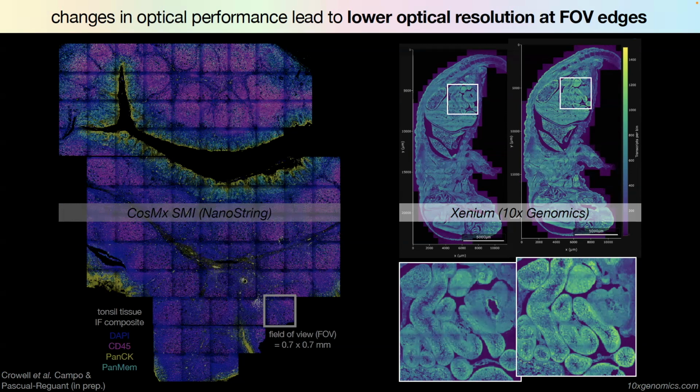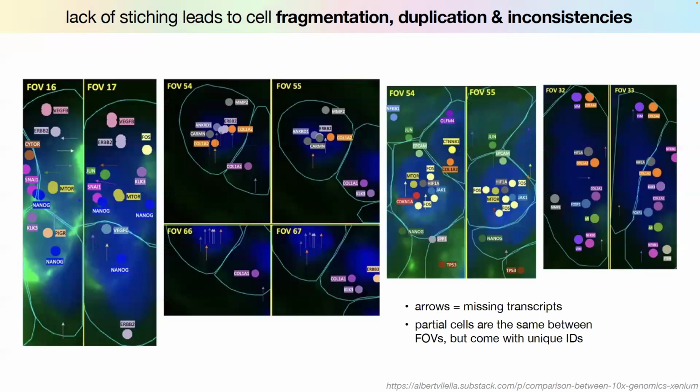And what you saw earlier is that I'm removing some of the cells that are just right on the border. And that's because, this is the blog post that I was writing about. They show two adjacent fields of view. That's the same cell. You see it has the same transcript, but then the green one is missing over here, and that one is only observed in this cell. And then they say the issue is we have fragmentation, we have duplication, and they don't have the same counts. They get different transcriptomes on these borders.